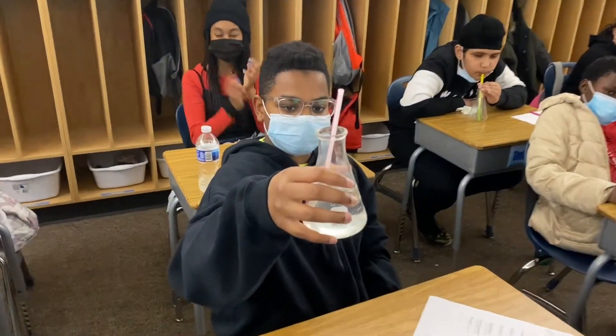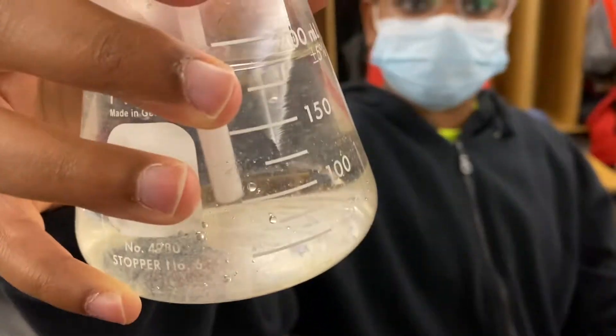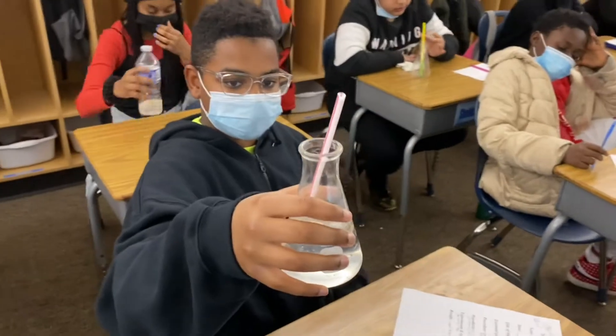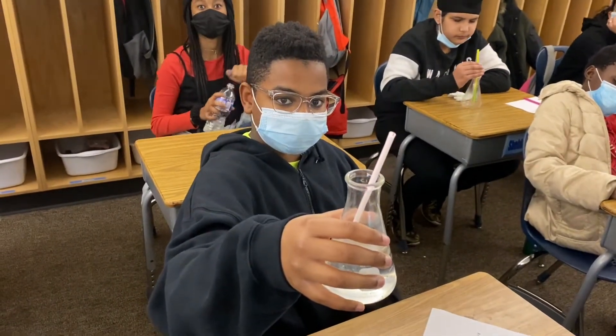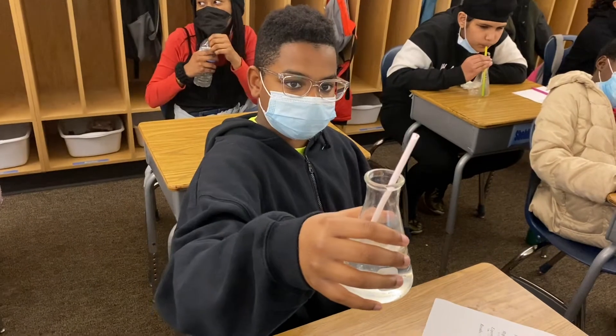I'm here with William and what we have filtered is lime water — you can see how clear it is. William is going to blow CO2 from his lungs into the lime water. We want to see it change from the calcium hydroxide to calcium carbonate.